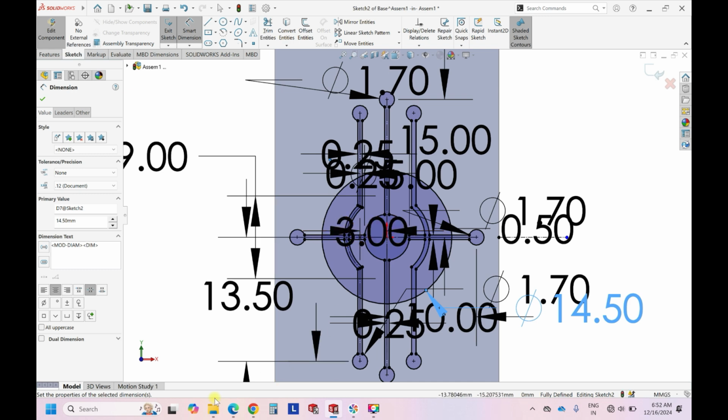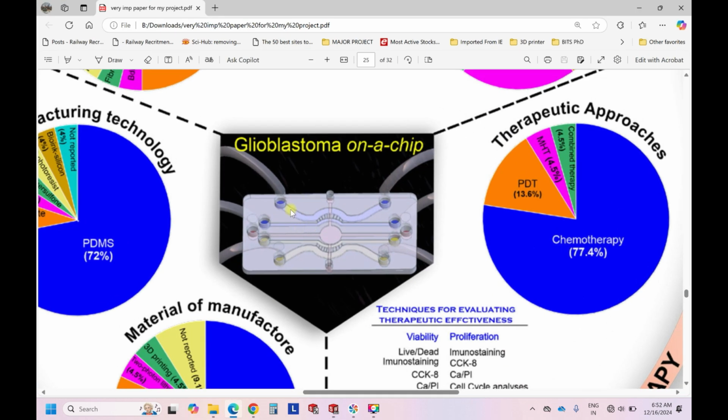And now if you see in this, it has these curves. So don't panic about how these curves are there. If you just assume that there is a straight line and you draw this, it can be somewhere around 45 degrees of angle, right? So consider it's a straight line, and then you draw a line towards this. So it is like a straight line and a 45-degree line. There is a relation between these two.